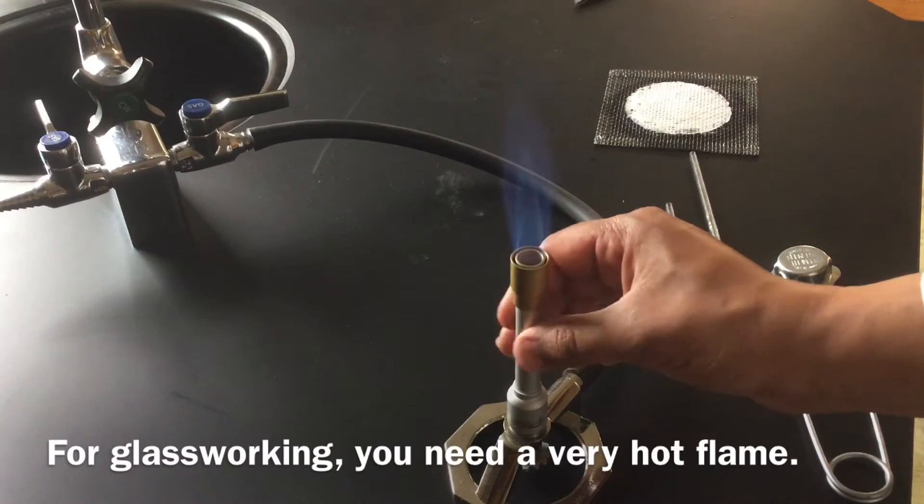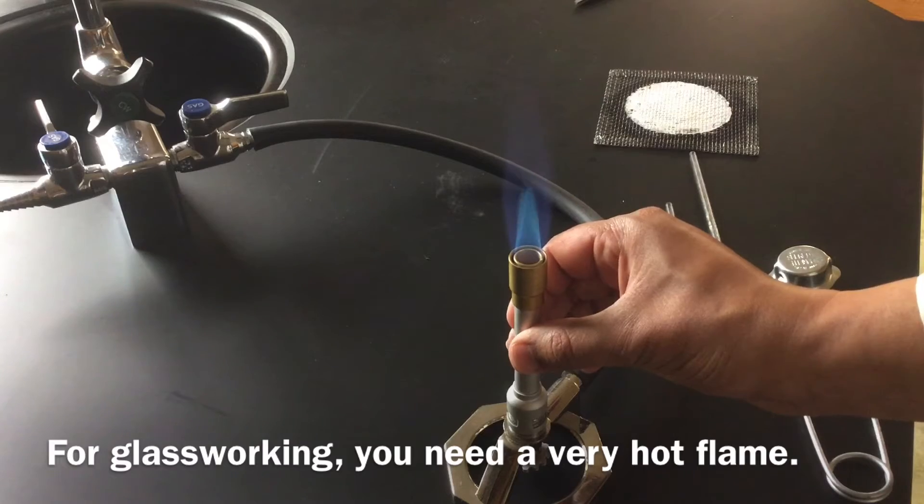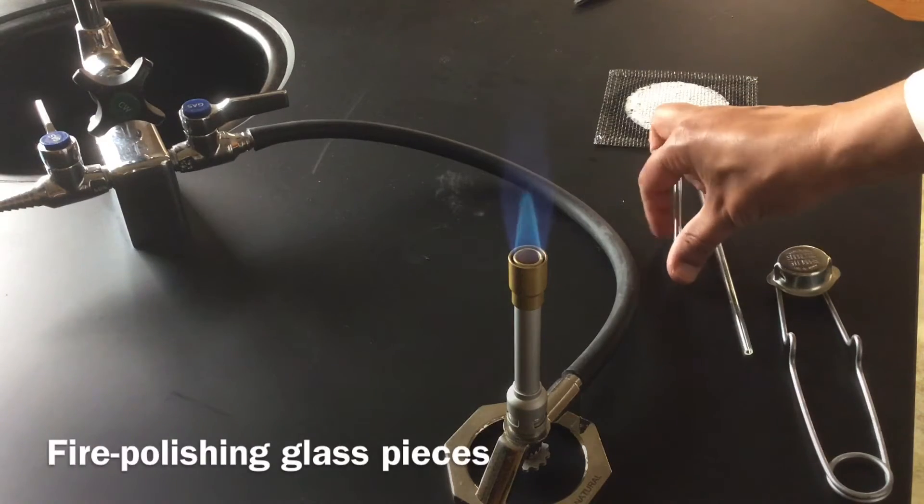This is making it cooler. Rotating the barrel like this makes it hotter. And now I'm going to fire polish the piece of glass.